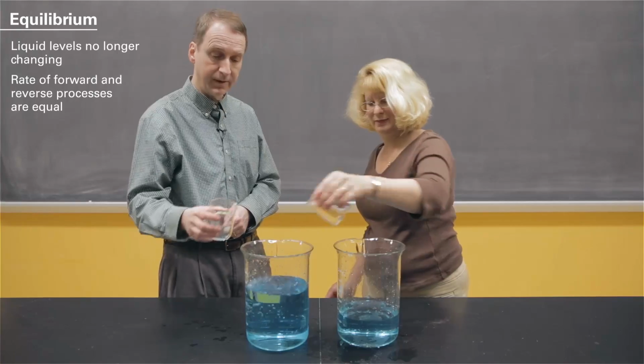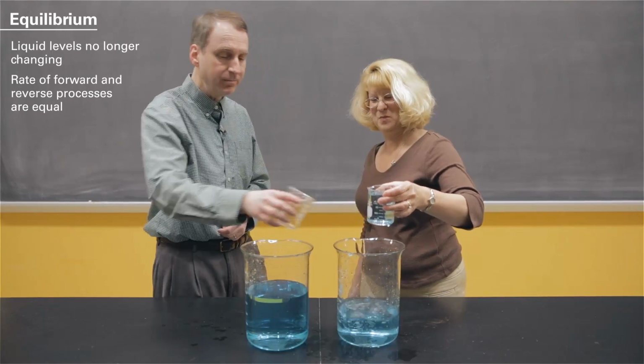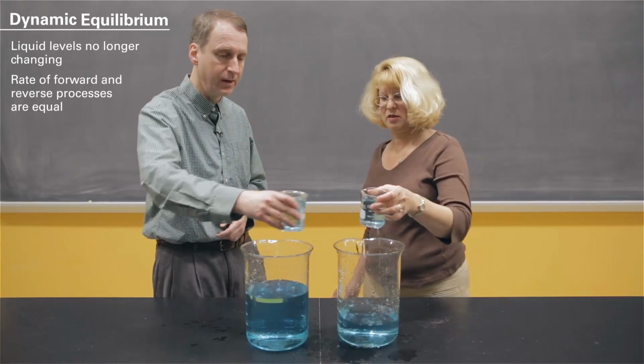And we could stay here all day, go another hour, 2 hours, 3 hours, minus what is spilled, and the levels in the big beakers would not change. Now this is a dynamic equilibrium. The forward process and the reverse process are still going on.